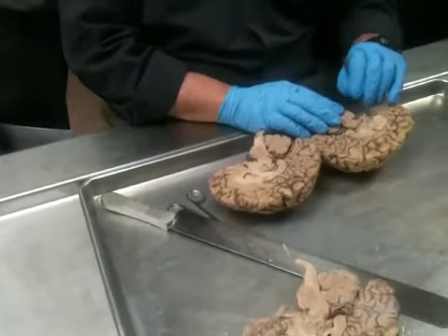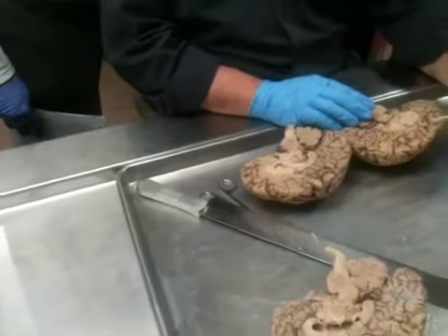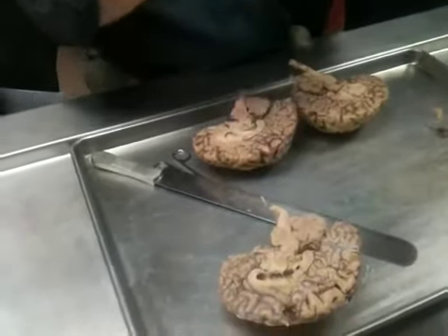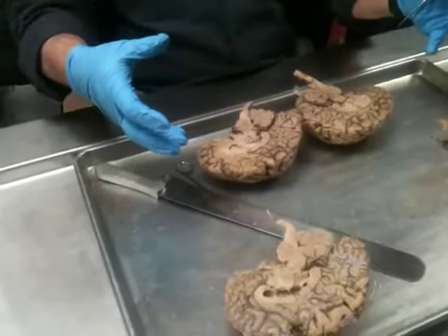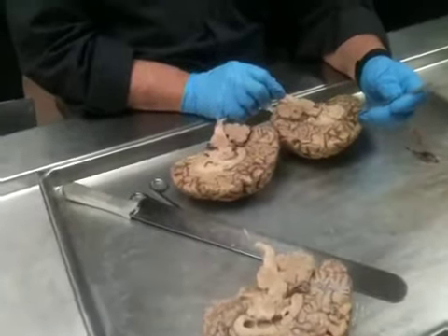On the other side, here's the fornix coming around. This side's torn up a little bit. If you notice, there's a track like that. That's where those skulls had the little wooden plug in them, and they stick a large needle in there to infuse a lot of extra fixative. So that's why it's torn up. Okay, but that's where that is.